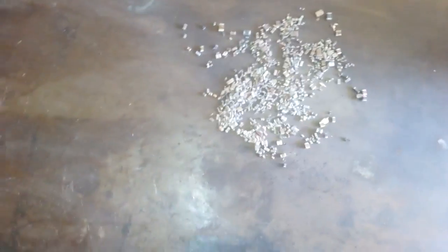So what I do for the first is I want to crush that stuff to the finer dust, and I do that with a hammer, the same like IC chips. So maybe for some of you, this is not a good way, but for the small amount which I have now. For crushing, I use, now I'll show you.